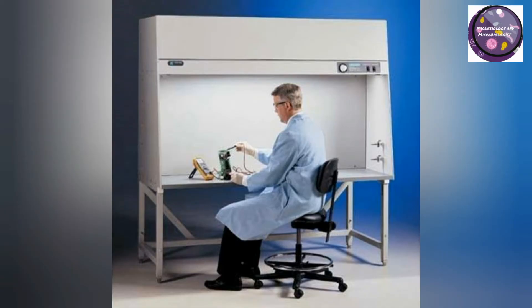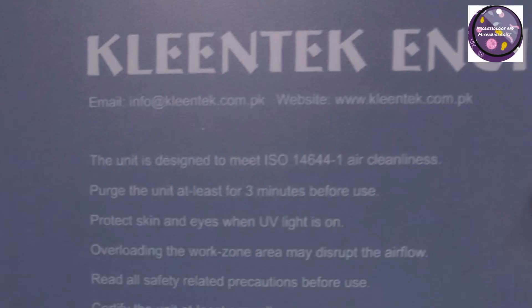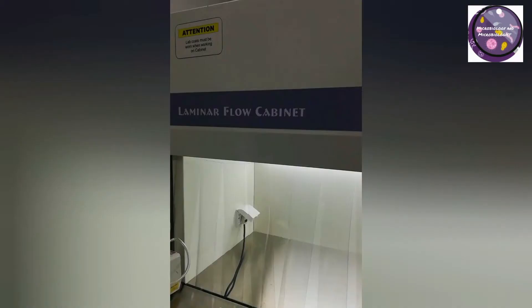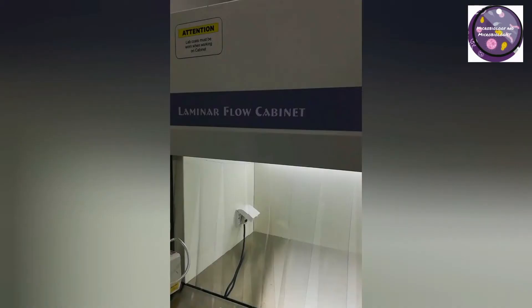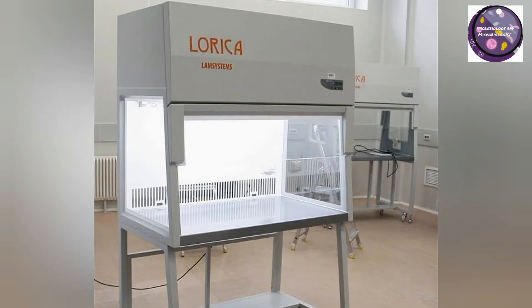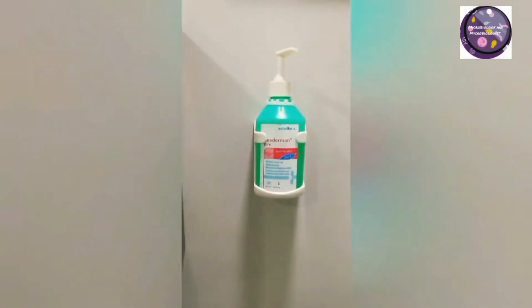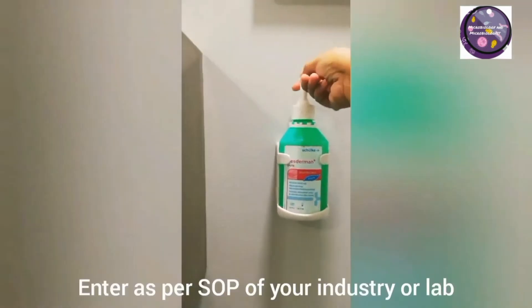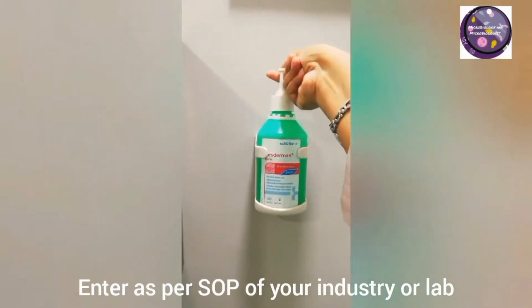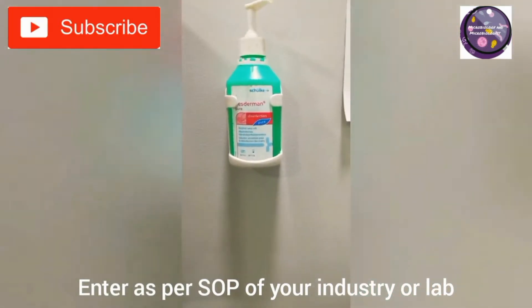Our member will show you the brand Clean Tech Laminar, its uses and functions. This video is related to laminar airflow hoods, which is basically a clean area that falls in Class A of clean rooms.